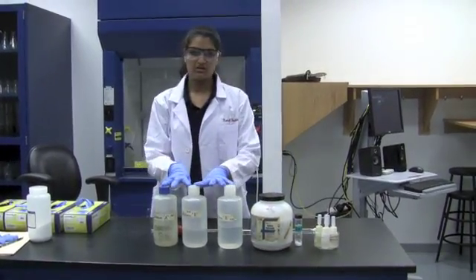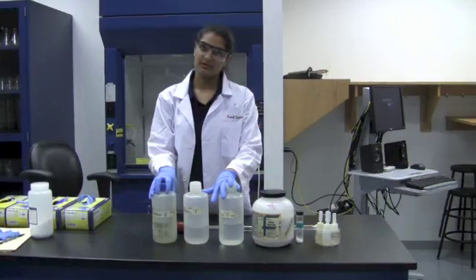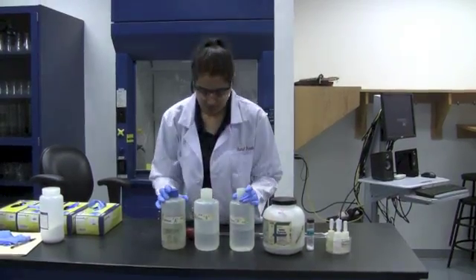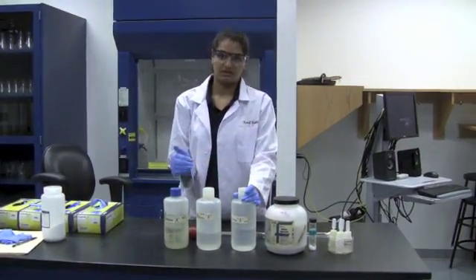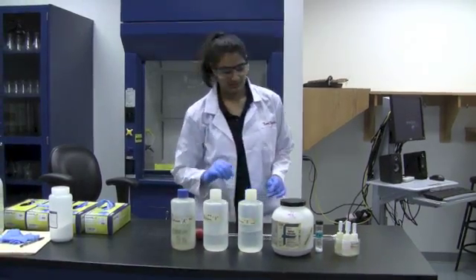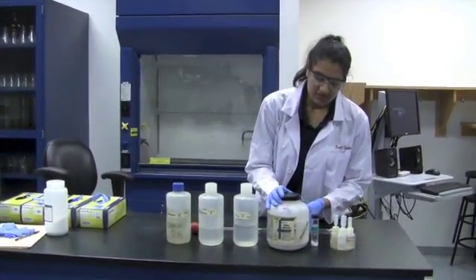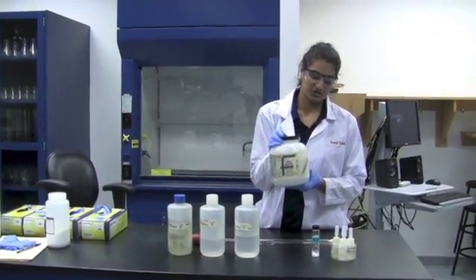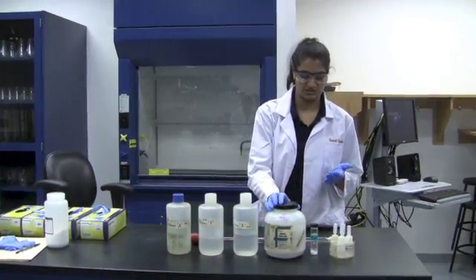You're going to be given an unknown, which contains a certain amount of acetic acid, which you will be determining in your calculations. When you do this, you want to write down the unknown letter in your lab notebooks. Next, we have solid sodium hydroxide, which is going to be used to prepare a sodium hydroxide solution, which will go inside your burette for the titrations.